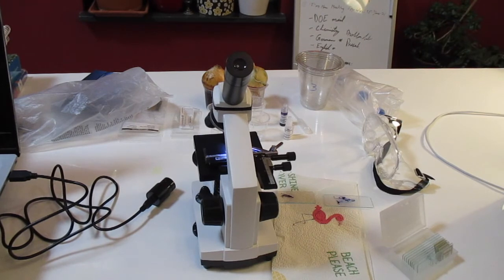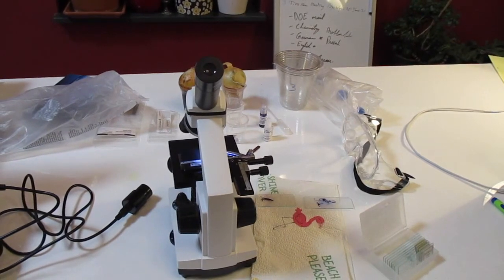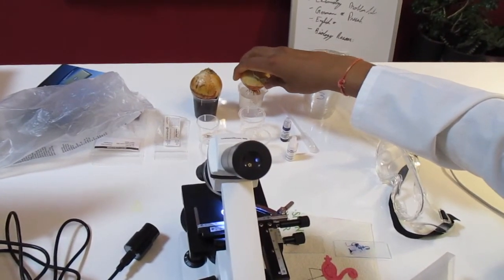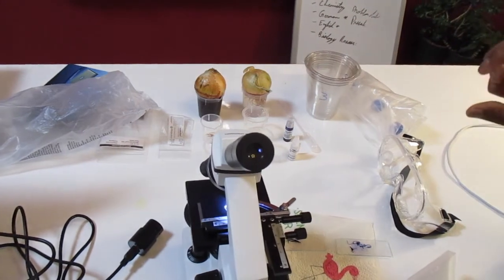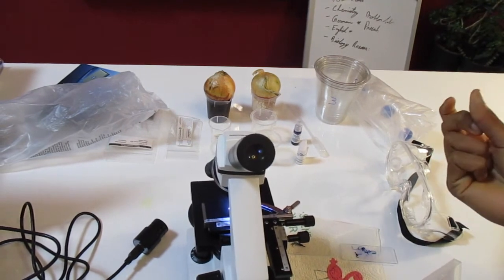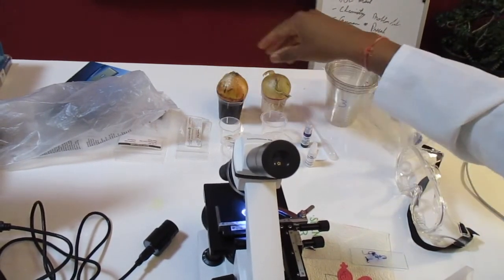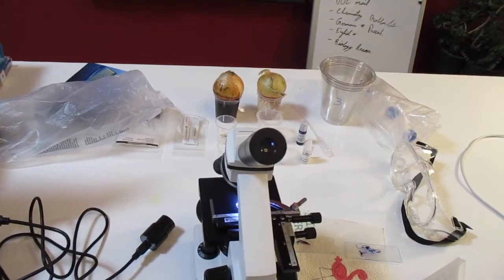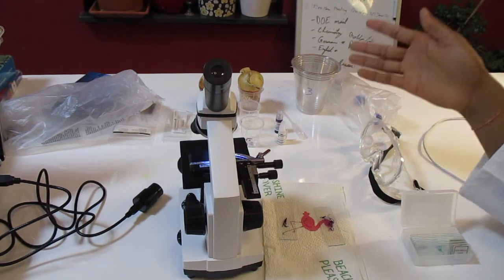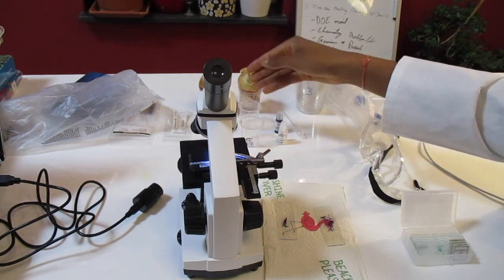And now we get to the procedure. So how we conducted the experiment was, first we had the onion bulbs. These onion bulbs, we grew them in water, and we let the roots grow 1 centimeter in length. After both onions had their roots 1 centimeter in length, we took one onion and placed it in the caffeine solution right here, and we left this one right here to just keep on growing in the distilled water. We harvested the root tip of the onion bulb in distilled water and in caffeine, and placed the root tips separately in beakers with 5 drops of HCl.